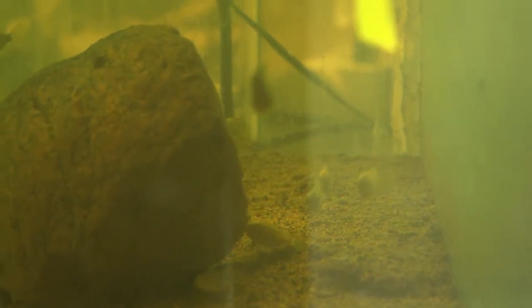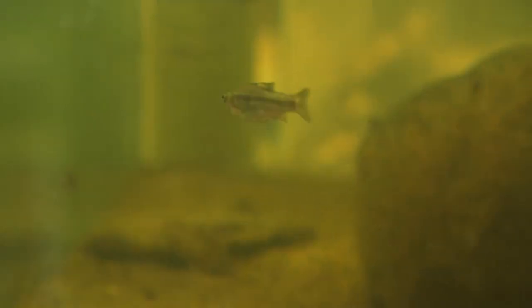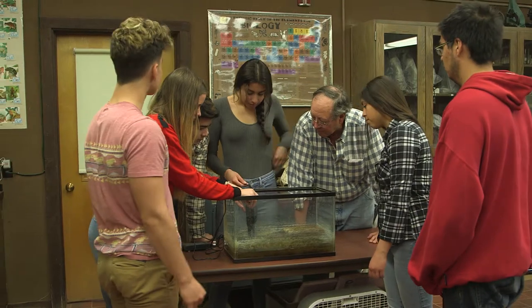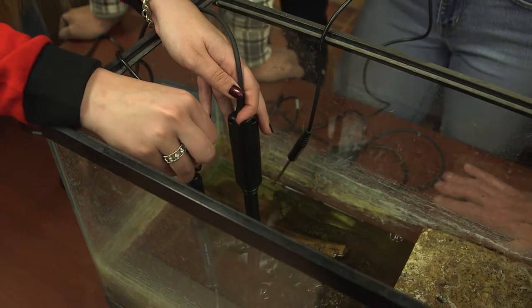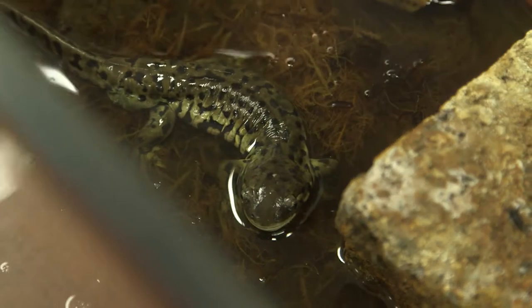We'll let this run for a little bit and come back. We're going to sample in these two other systems. If that's a stream running into a pond over there, what would this be like outside? Puddle. And what do you notice about the bottom of this? It's gross.